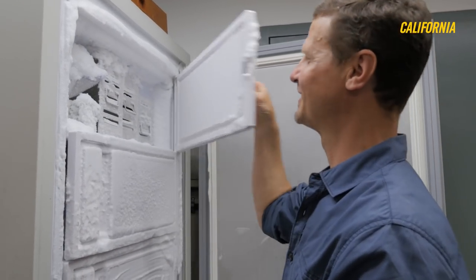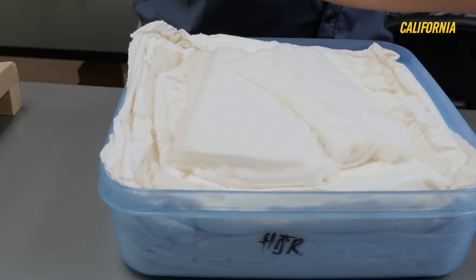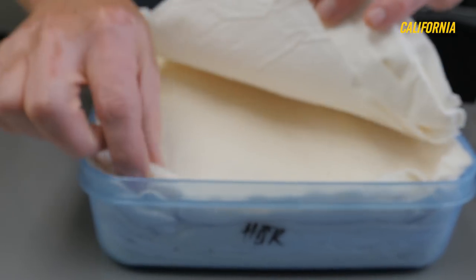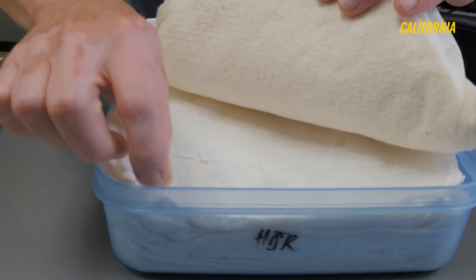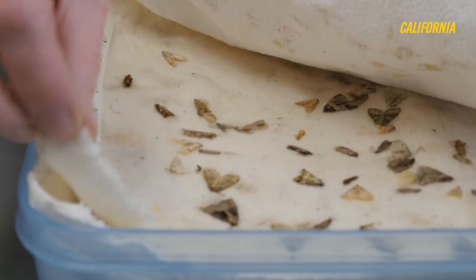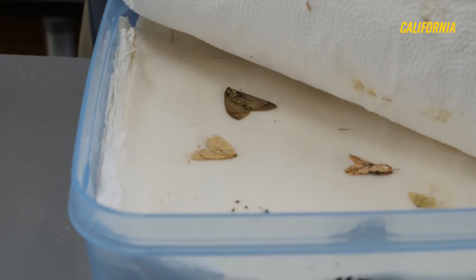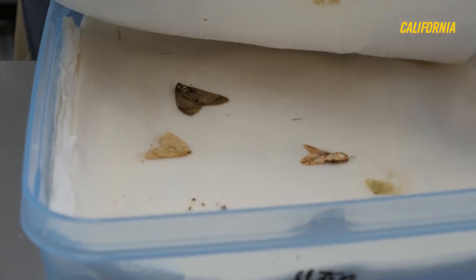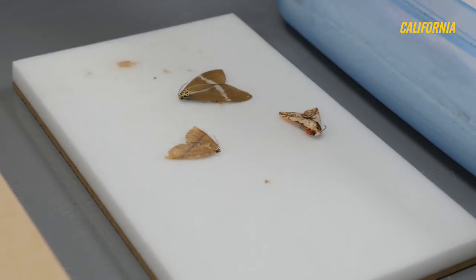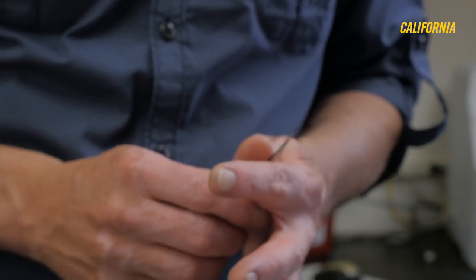These have been here for a little while. When I'm in the field, I need to somehow manage these specimens. We'll bring a box like this with layers of tissue, and in between the layers of tissue we will put some moths. There's some damage that occurs, but for the most part they come through quite well. Anything with a different label will be a different layer within the box.